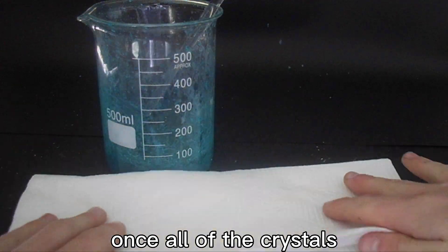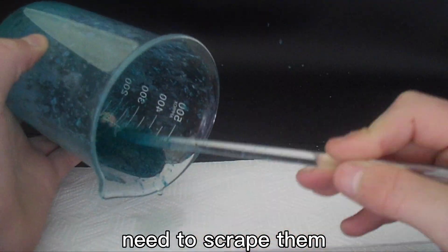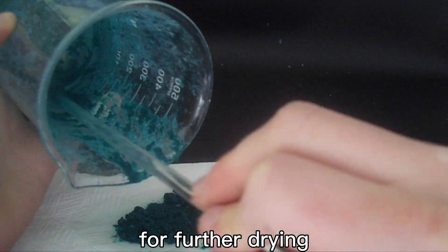Help me. Once all of the crystals have crashed out, you need to scrape them onto a paper towel or filter paper for further drying.